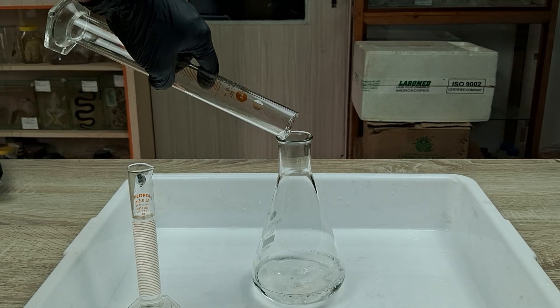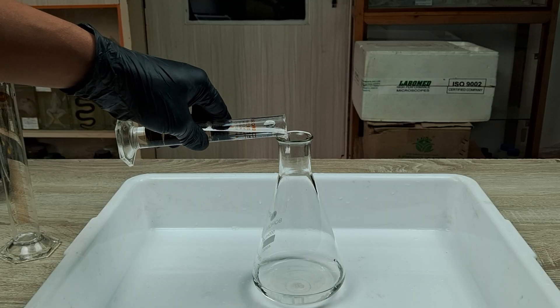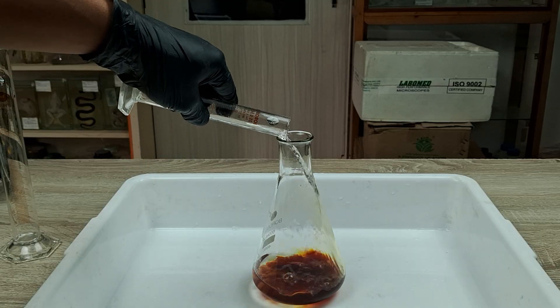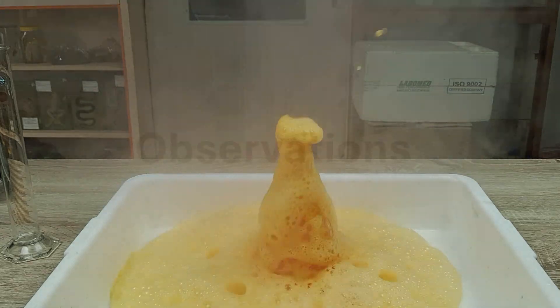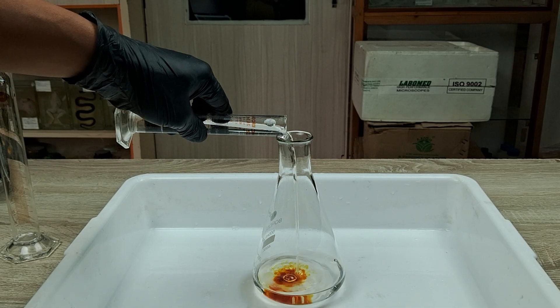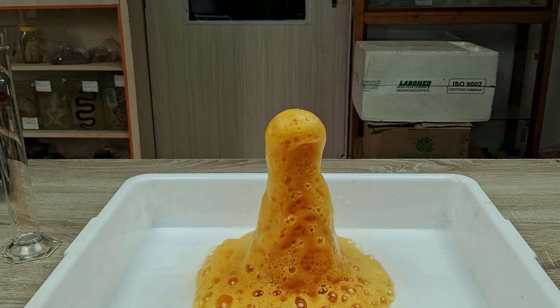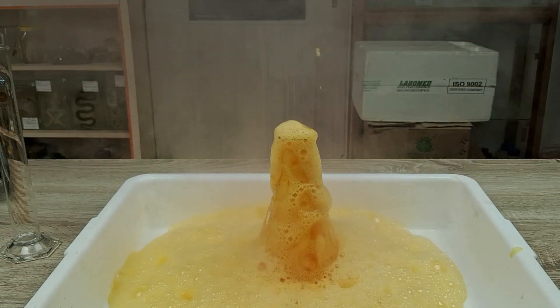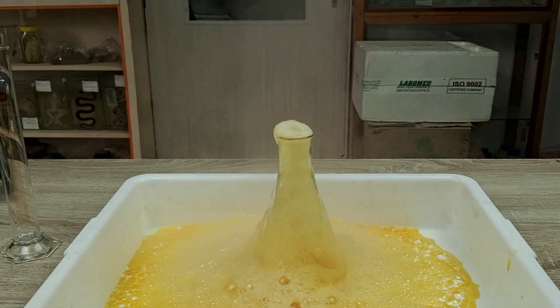Now, carefully but briskly pour the entire 20 ml of potassium iodide into the flask containing the peroxide. Observe what happens. As soon as you pour in the iodide solution, the reaction mixture violently erupts from the flask as a mixture of steam, gas, and water.